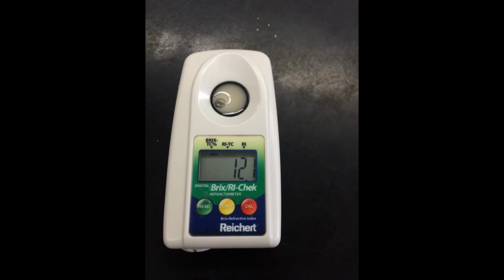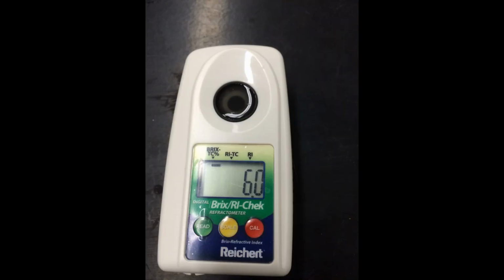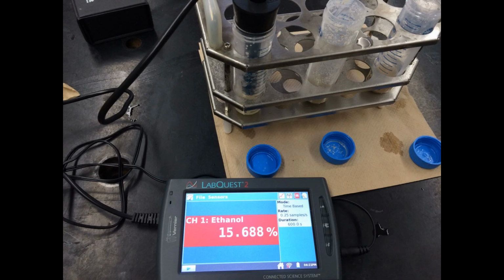Every 20 minutes, measure the ethanol and glucose concentrations. Add glucose and ethanol data to your table. Repeat these measurements in 20-minute increments as many times as possible to observe initial rate of fermentation. Then leave Falcon tubes to the common water bath for 48 hours of fermentation. At the end of the 48 hours, take the final glucose and ethanol measurements and record the data.